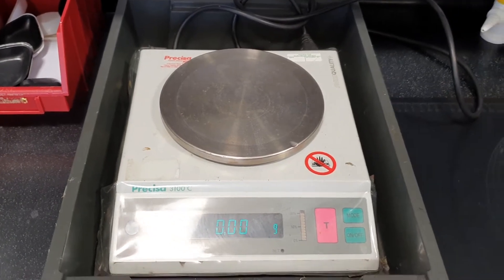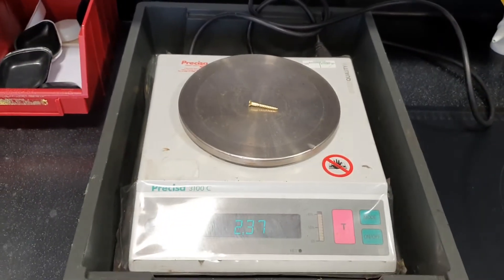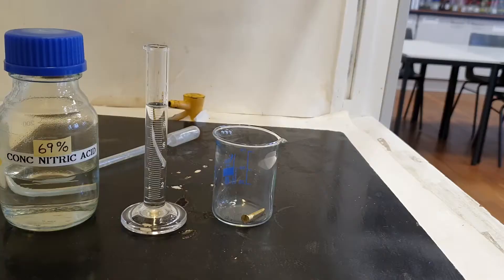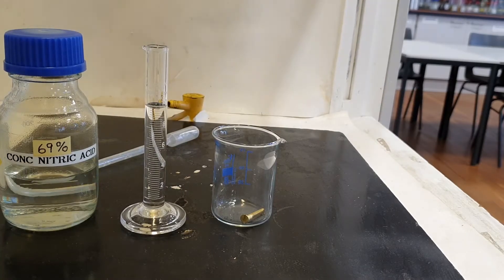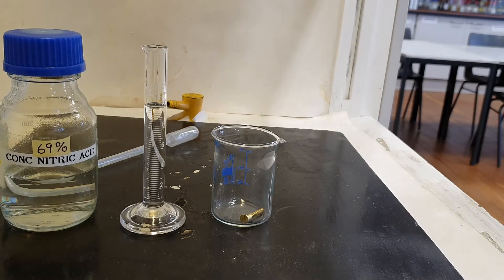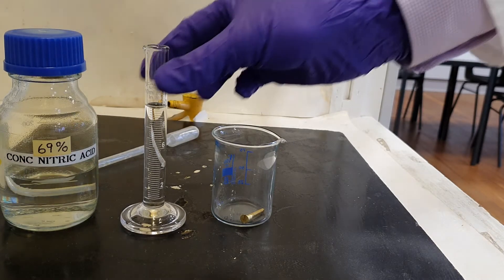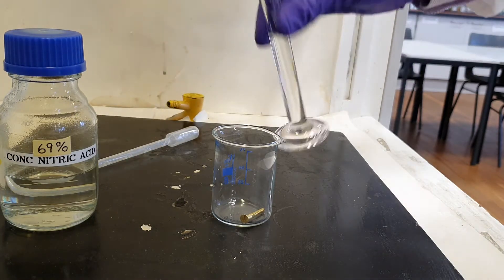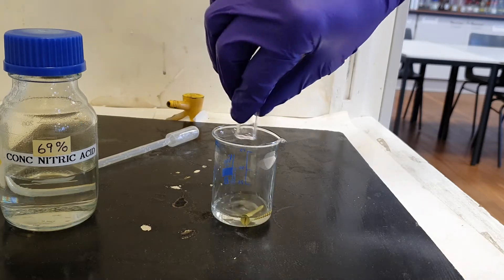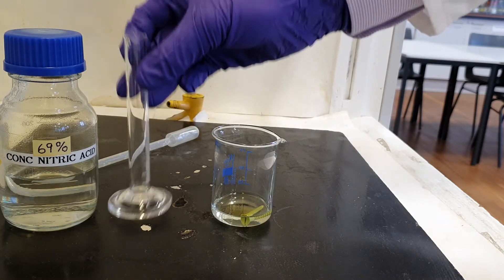Okay, first thing: find the mass of the brass screw. Now we know the mass of the brass screw, we need to react the brass screw with some concentrated nitric acid — 10 cm³ of concentrated nitric acid.